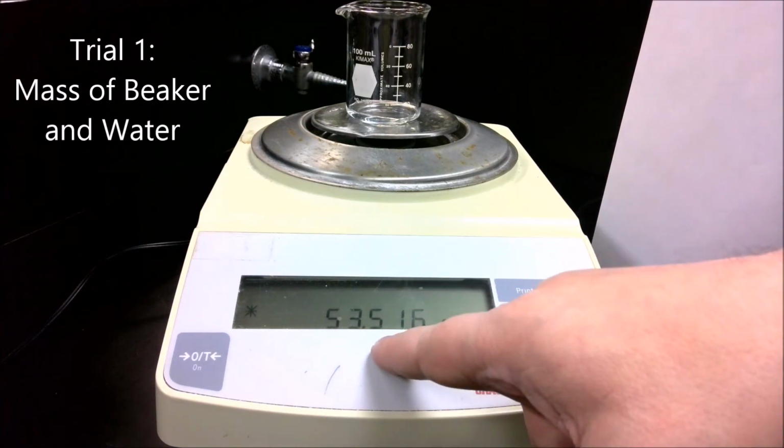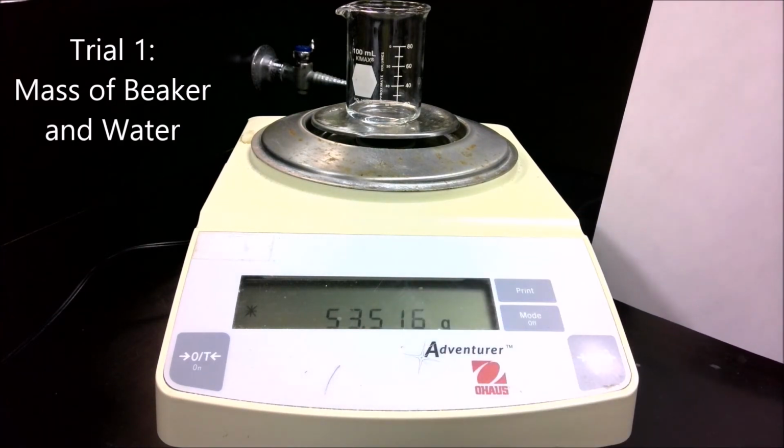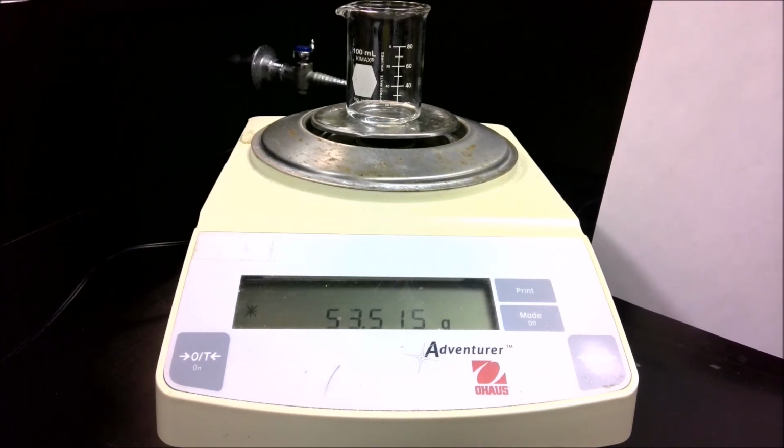So I can record the mass of the beaker plus the liquid. A little subtraction will give me the mass of the liquid. Combining that with the volume, I can calculate the density. Let's try a second trial. Let me go ahead and get that set up.